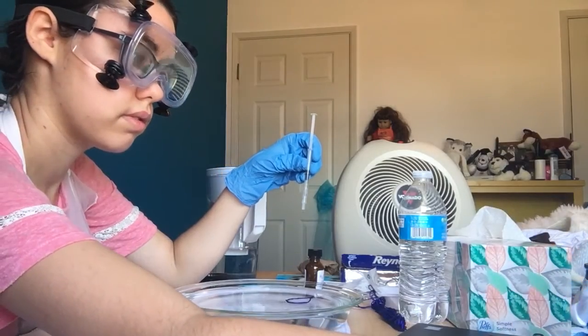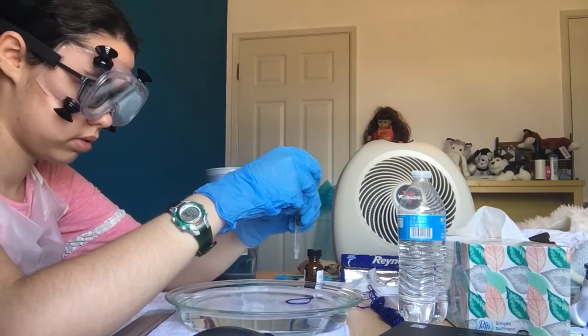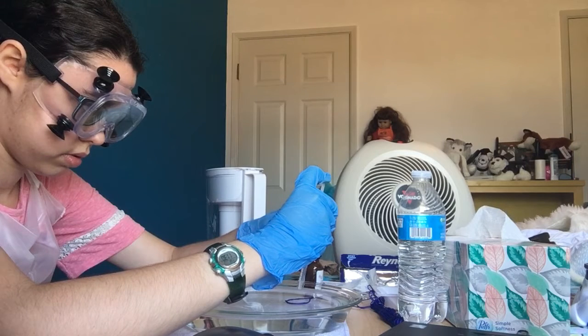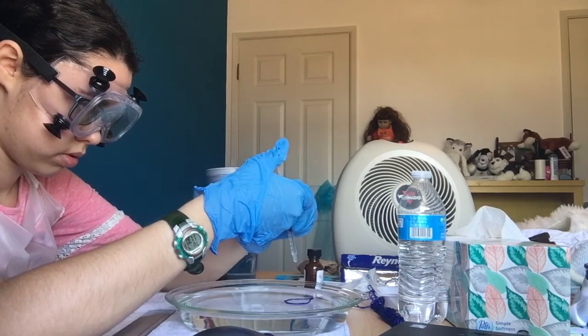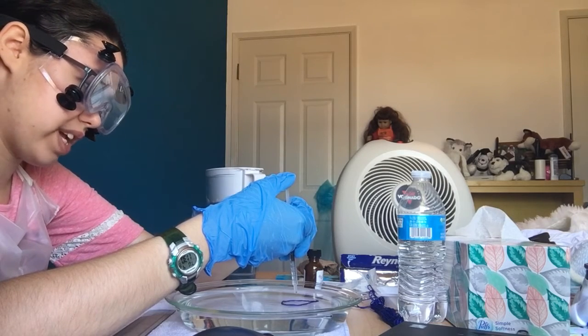Okay, and then let me calculate. These are my last. The thing is, I don't want to overdo it again like last time.